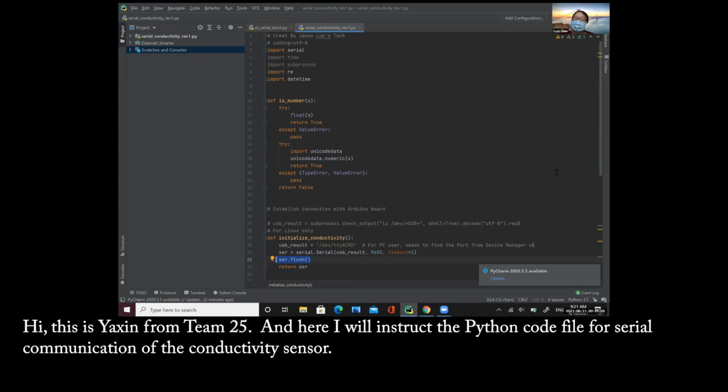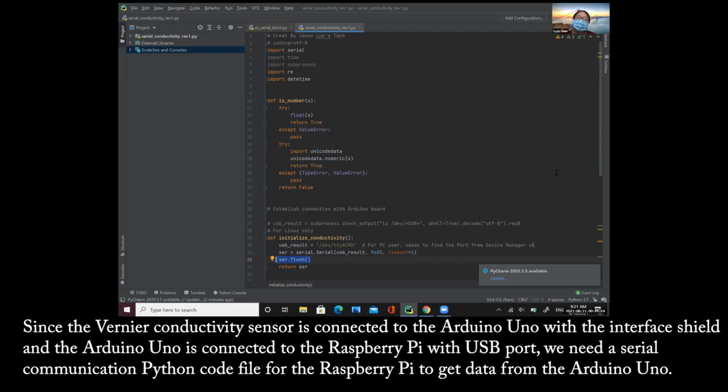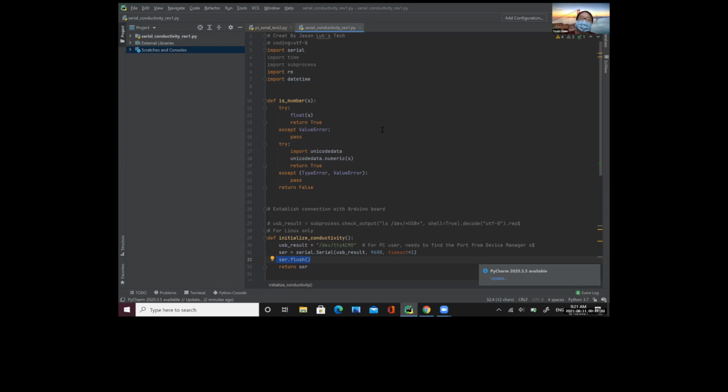Hi, this is Yasin from Team 25, and here I will go through the Python code file for serial communication of the conductivity sensor. Since the Vernier conductivity sensor is connected to the Arduino Uno with the interface shield, and the Arduino Uno is connected to the Raspberry Pi with a USB port, we need a serial communication Python code file for the Raspberry Pi to get data from the Arduino Uno.